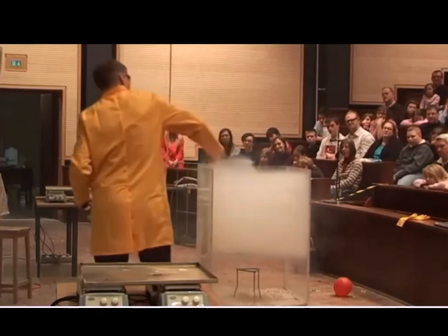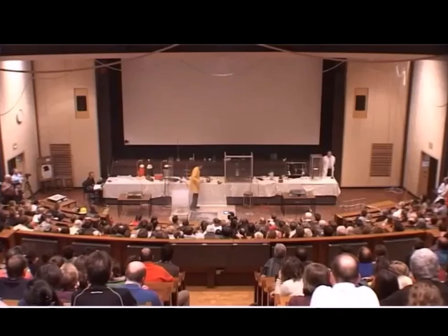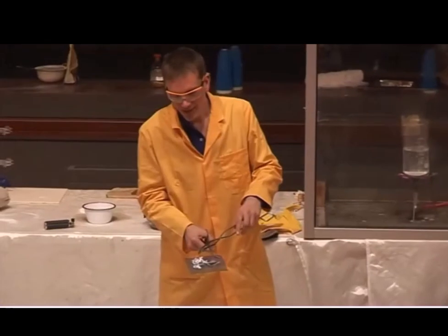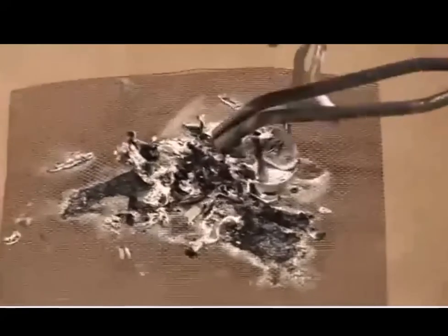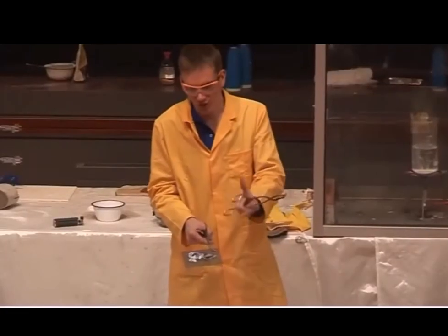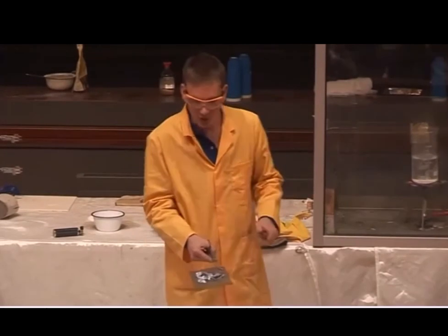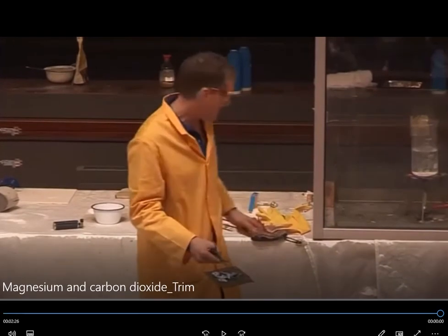And then when he lifts out the final mixture there, we should be able to see the black carbon. So there he's showing there's some of the white magnesium oxide, but amongst that you see the black stuff there, and that's carbon. So magnesium plus carbon dioxide, that gives us magnesium oxide plus carbon. Brilliant white light, white powder of magnesium oxide, and black solid of carbon.